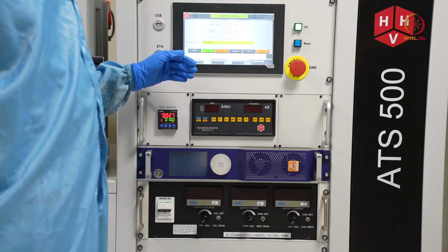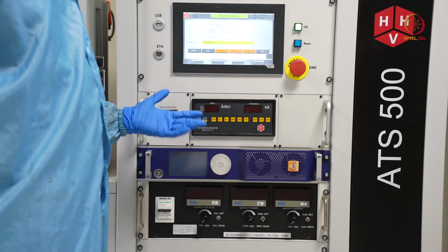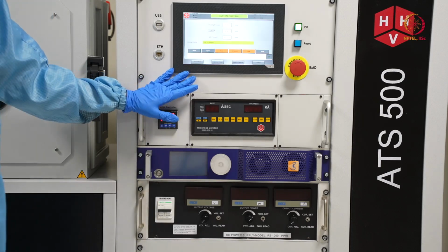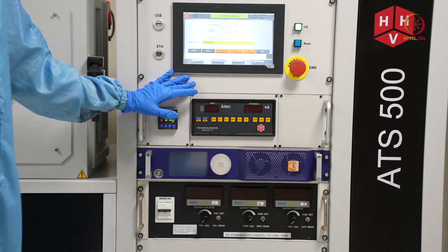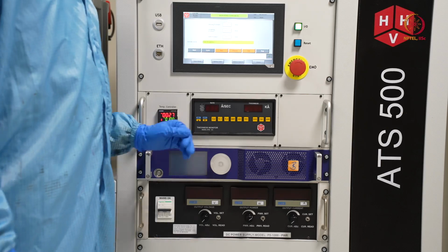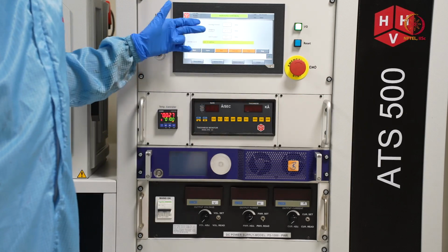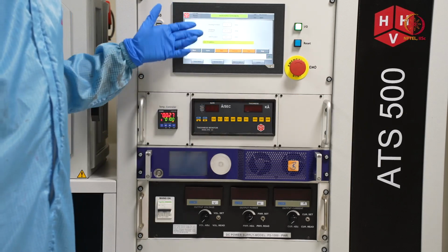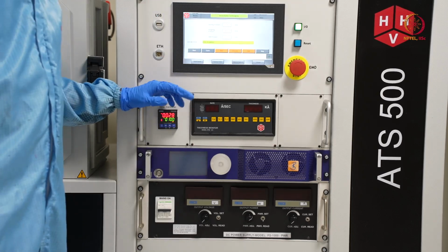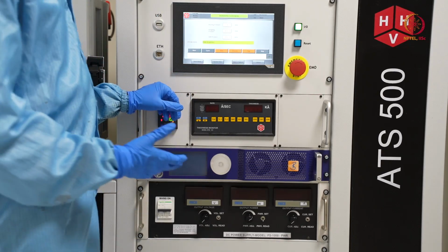By that time we will keep the vacuum cycle on, so that it will keep on going. But we can even wait with the chamber in sealed condition also. We already waited for almost 10 minutes, and you can see that continuous pumping was on. Pressure reduced drastically, it is now almost 2 e power minus 6, which is very good for one tool, and it shows that tool health is also good.